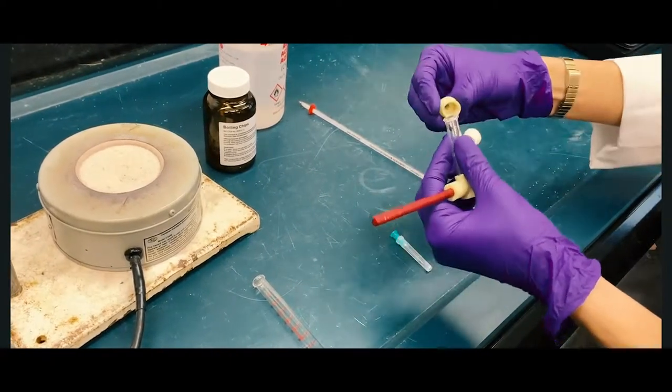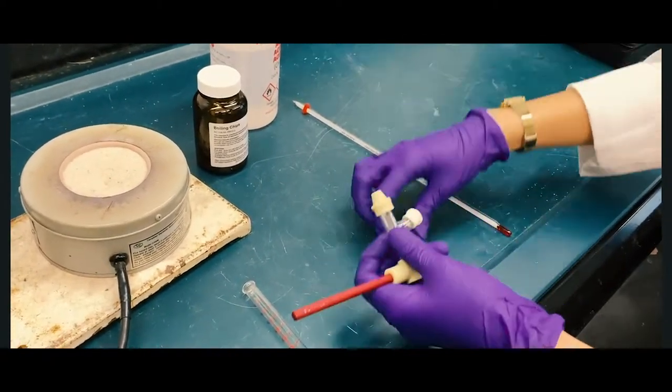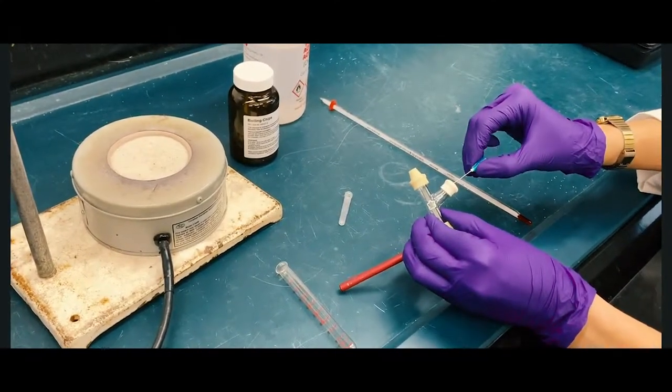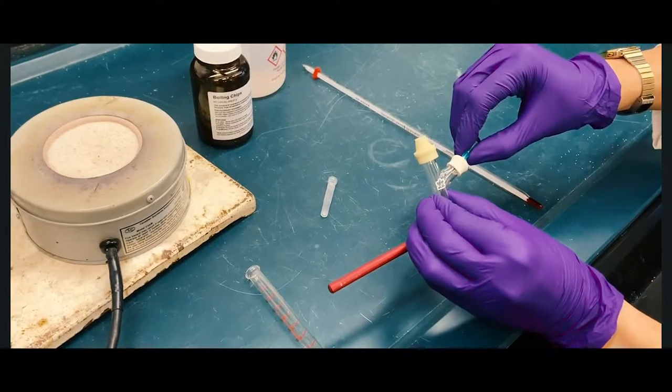Put the thermometer adapter at the top. Then carefully grab the needle and stick it through the rubber sleeve to release pressure when your solution begins boiling.